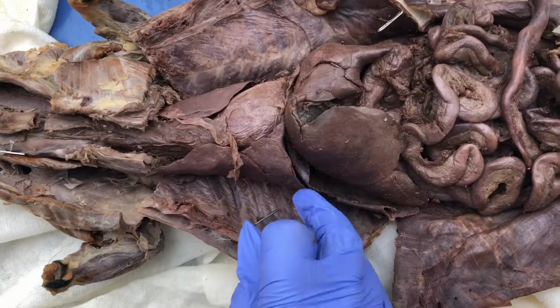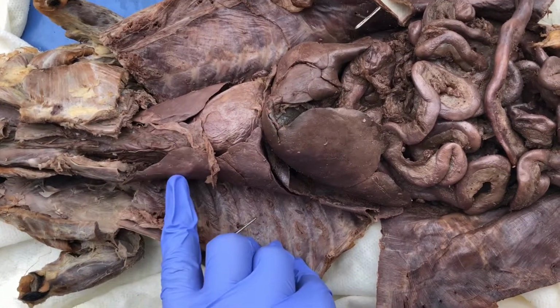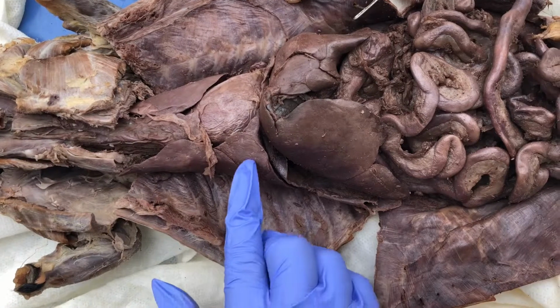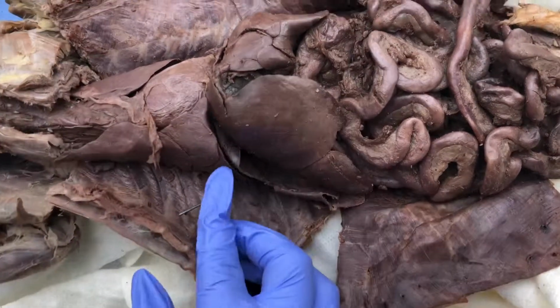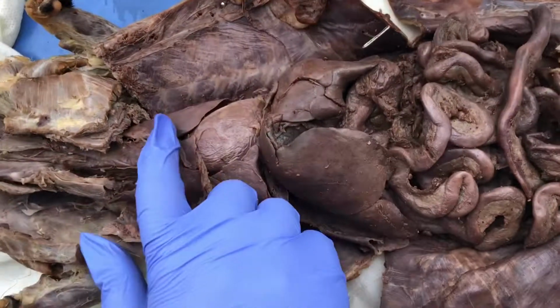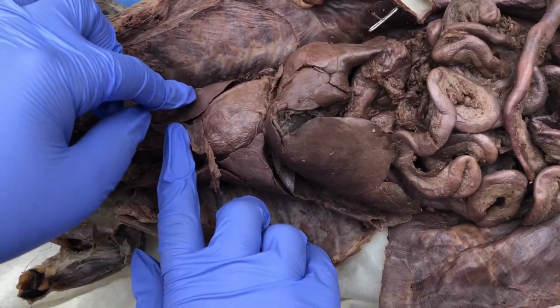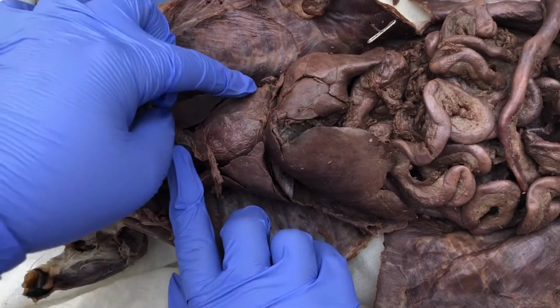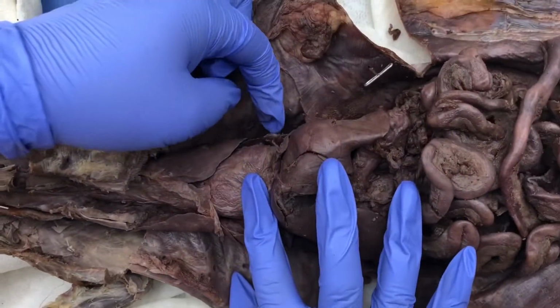Alright, so now to the lobes of the lungs. These help you breathe, obviously. So this is the right cranial lobe, and then this middle area is called the right middle lobe, and then beneath this is the right caudal lobe. Now moving over to the left side, this is the left cranial lobe, and then there is the left caudal lobe over here. Okay, good.